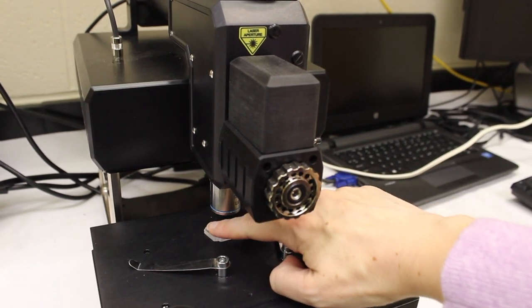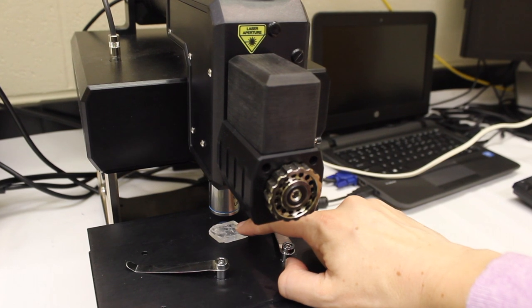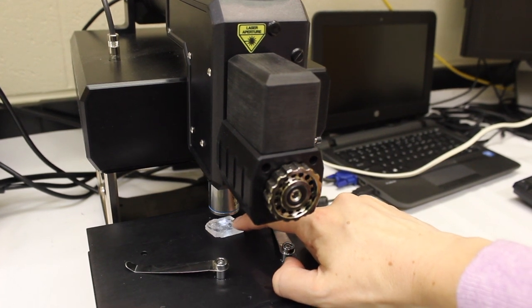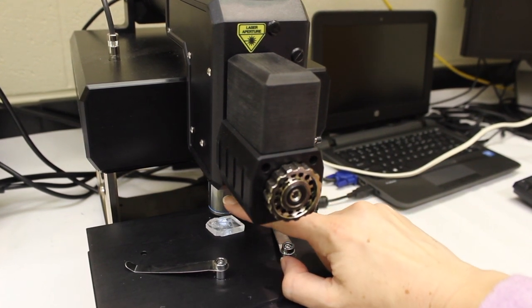Mineral samples and other solids you want to analyze should go on the stage, and you can focus on them using this objective.